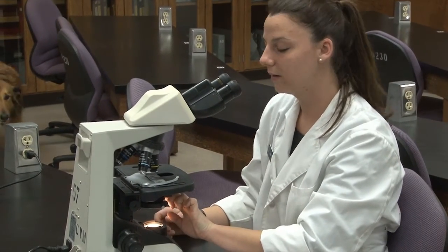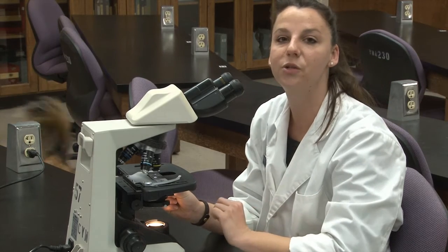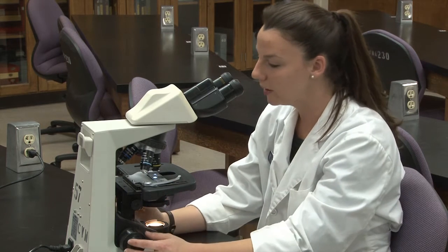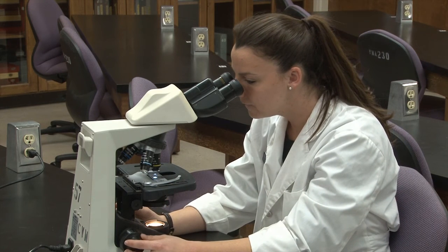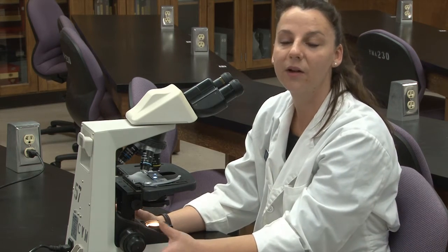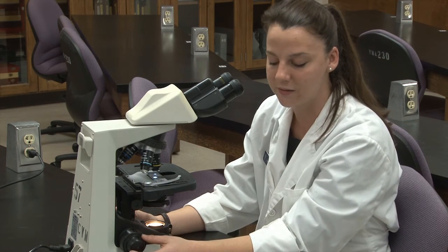You may also have to adjust the amount of light that you have. Adjusting the iris diaphragm helps us increase the contrast between things on the slide. If you're looking for things like eggs or things that aren't stained, increasing the contrast can really help you find them better. I'm going to open this iris up a little bit more and focus it with my fine adjustment. Using the coarse adjustment here could cause you to move the slide too close to the objective and that'll break the slide — it can also break your objective — so you don't ever want to use the coarse knob on a higher objective than 4x.